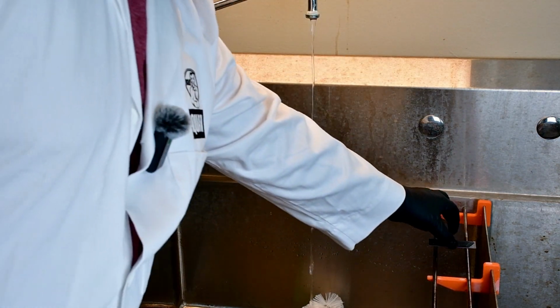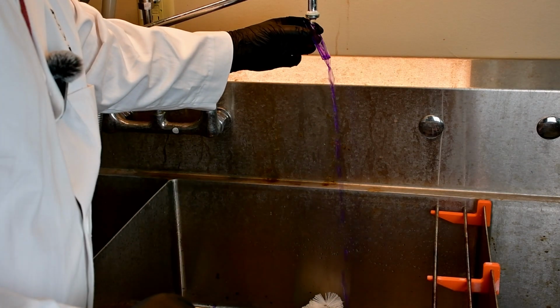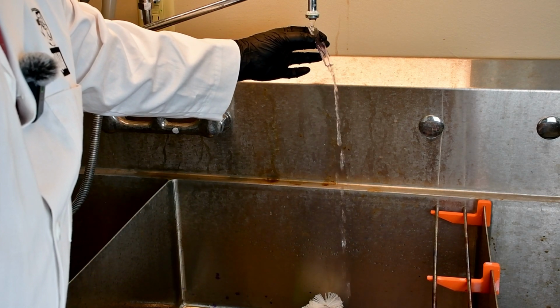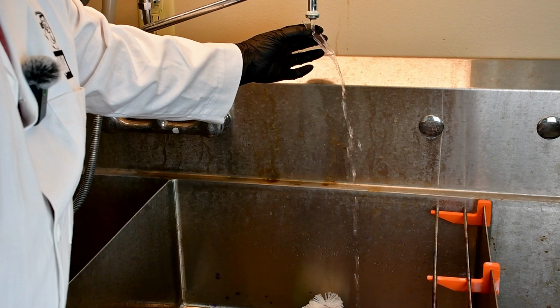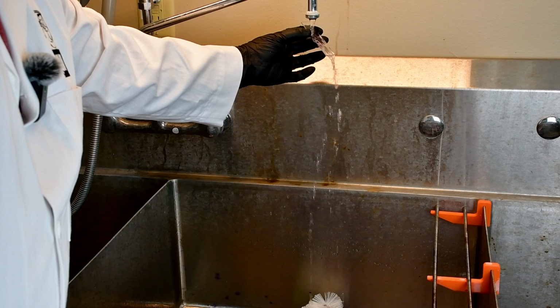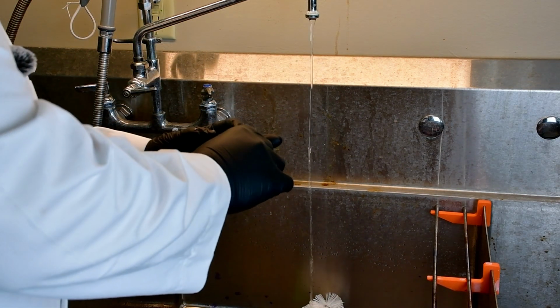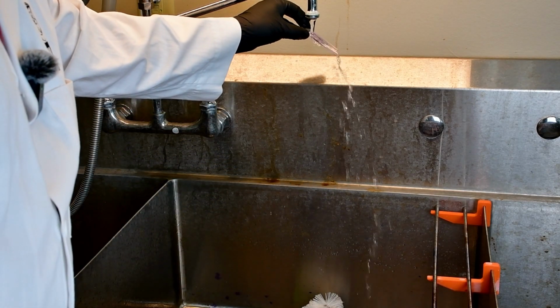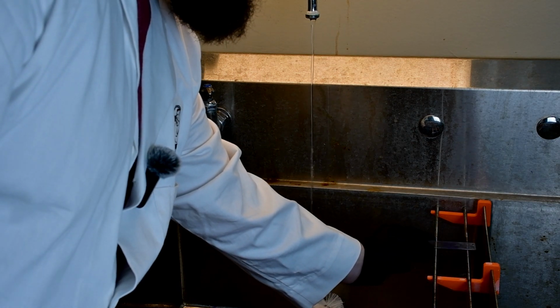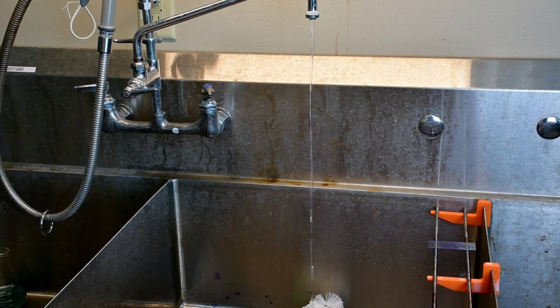There's my timer going. I'm going to take my slide with the stain, and I'm going to rinse off that stain quickly. Now, when I do this, I want to hold it near the top of the spout because I want high flow of water, but I don't want high water pressure. If the water pressure is too high, we can wash off our stain, wash off the organisms that we have dry fixed to the slide. Since we only did a room temp dry fix and we did not do a heat fix of the slide, that's necessary. And you do not want to do a hot fixing of the slide because you'll kill your microorganisms.